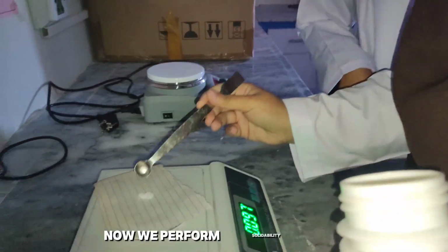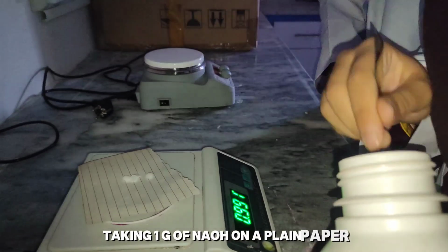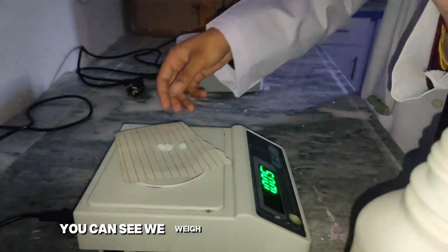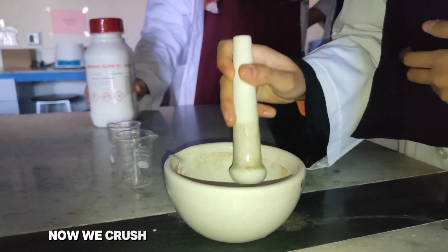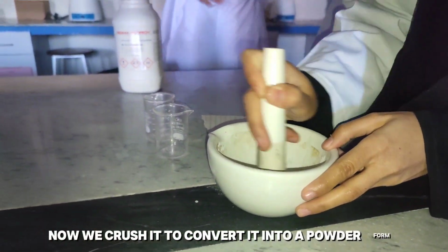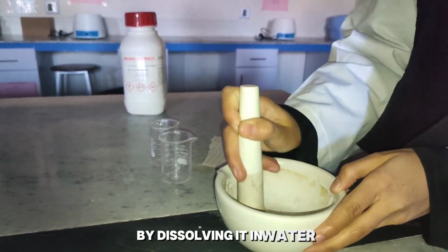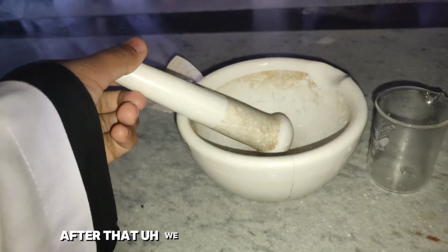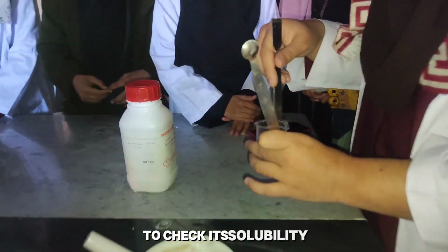Now we perform the solubility test, taking 1 gram of NaOH on a plain paper. You can see we weigh NaOH. We exactly take 1 gram of NaOH. Now we crush it to convert it into powder form and prepare a dilute solution by dissolving it in water. After that we add phenol to the NaOH solution to check its solubility.